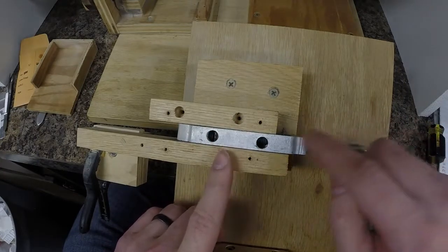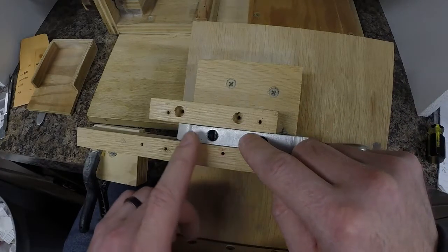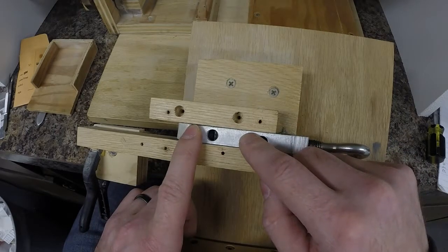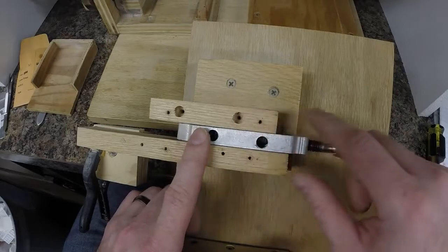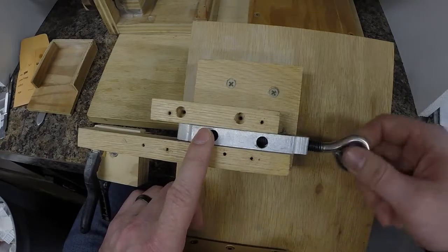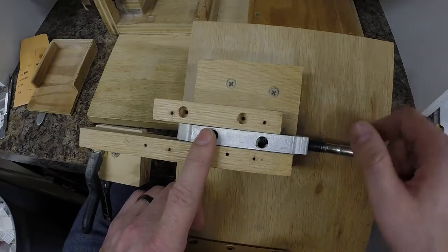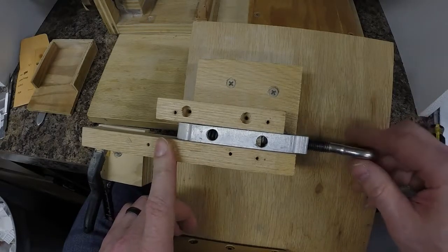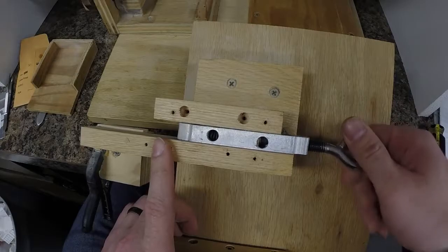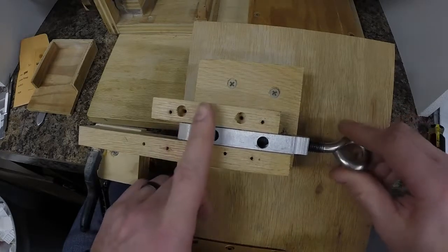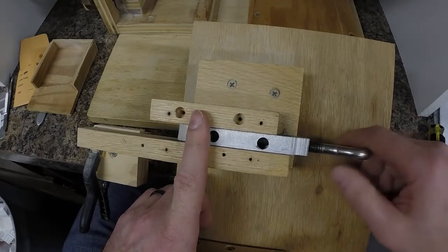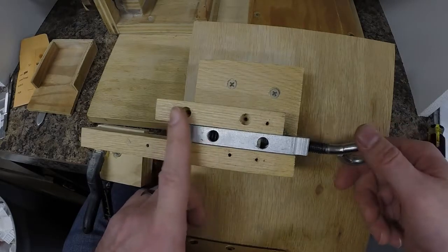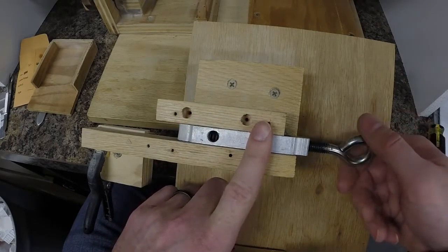Inside the turnbuckle, there is a block of wood and a spring. You need the spring inside to provide the tension to actually push the arm back. Without that spring, if you turn this back, it would just move the eye bolt out and the arm would be left in the same spot. So when you turn it in, you compress the spring and push the arm to the left. When you unscrew it, the spring is actually pushing the arm back to the right.